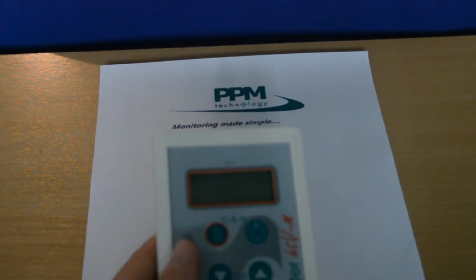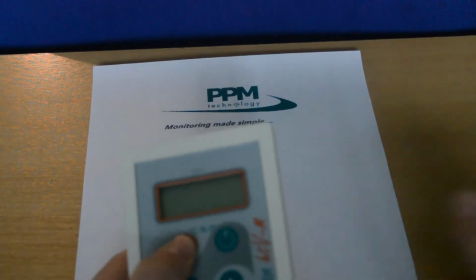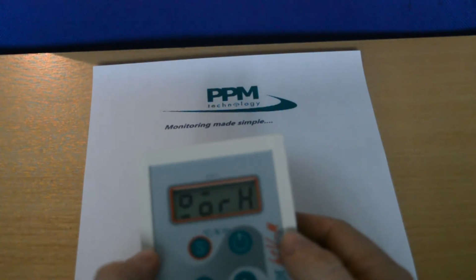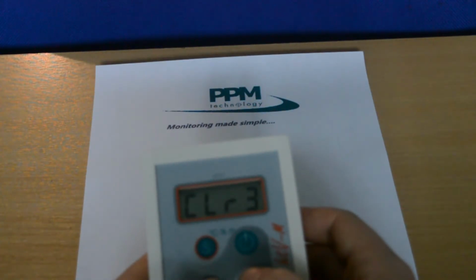For clearing the memory of all saved samples, enter the data viewing mode as first shown when accessing the data. To do this, hold down the S button whilst turning the instrument on. Now you need to hold down both the up and down arrow buttons. This will start the deletion process. You must keep both buttons pressed as the display shows a countdown to the complete deletion.